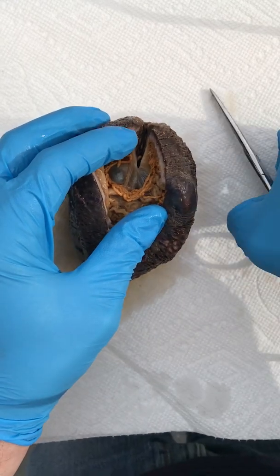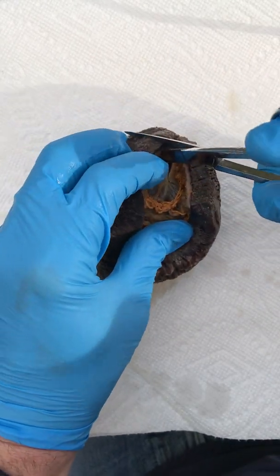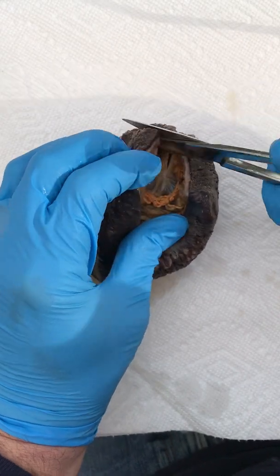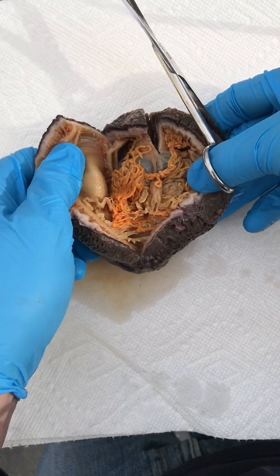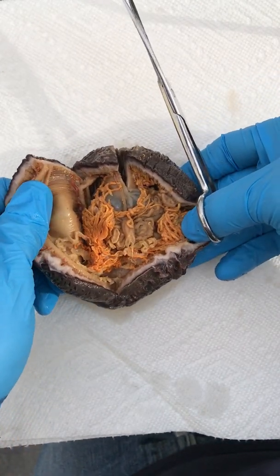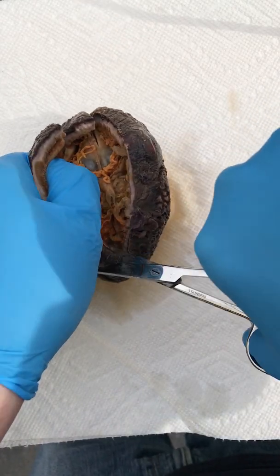I'm going to do a cross incision so I can try to open it up a little more. The muscle wall is incredibly thick in these organisms, as you can see from my efforts trying to cut through them. And if you look inside here, it's just an absolutely strange looking organism.